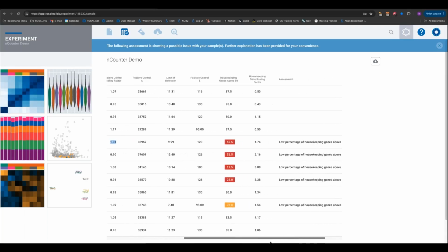Next, we can look at our limit of detection. So this is the value we took in this particular sample. We take the average of the negative controls, add 2 standard deviations, and then we compare this value to positive control E. If this value is less than the limit of detection, then you will get a flag here. In this case, this is well above. So all these positive control E's are much, much higher than our limit of detections, which is the column to the left. So clearly there's no issues with sensitivity in this data set. It's performing really, really well.